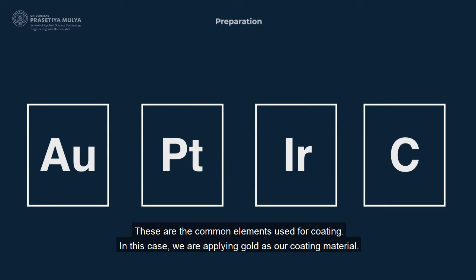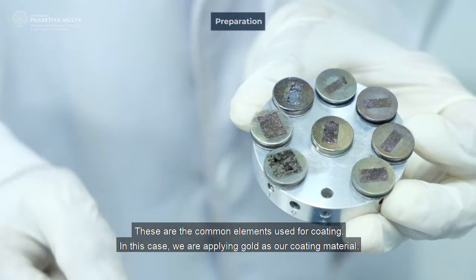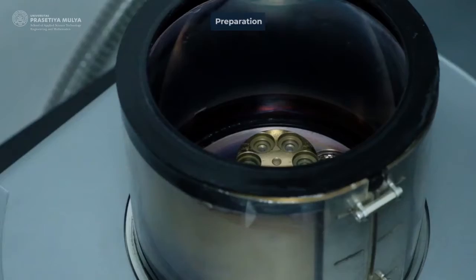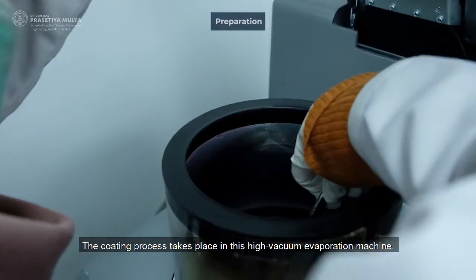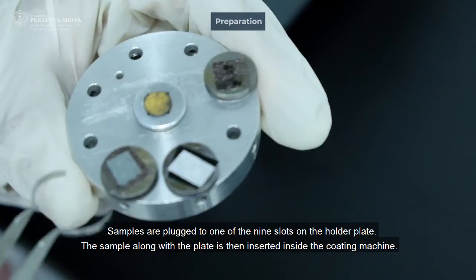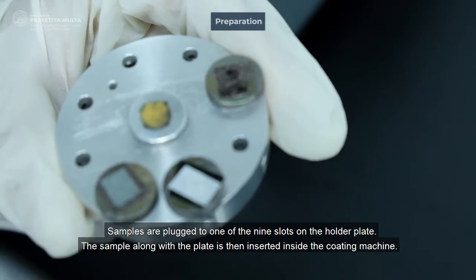These are the common elements used for coating. In this case, we are applying gold as our coating material. The coating process takes place in this high vacuum evaporation machine. Samples are plugged to one of 9 slots on the holder plate.